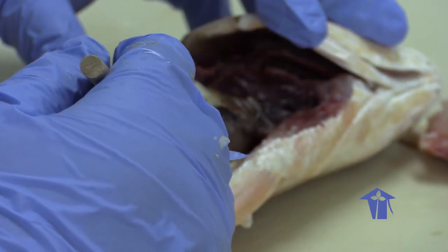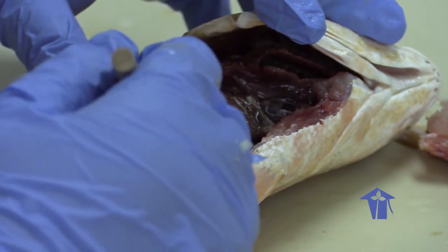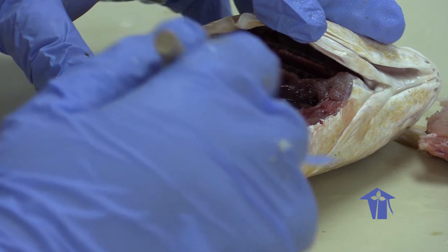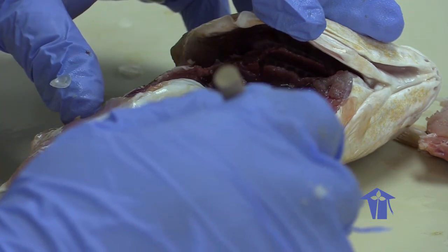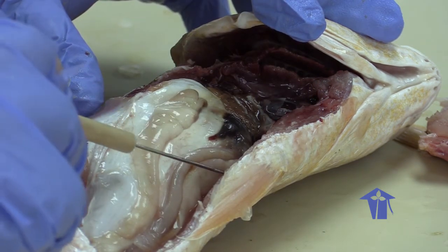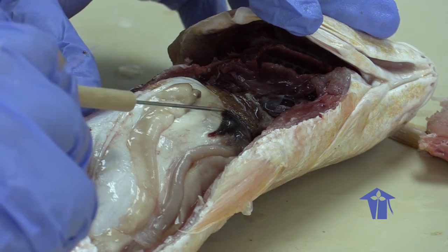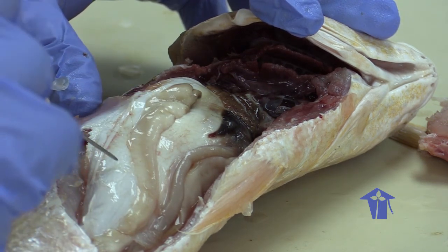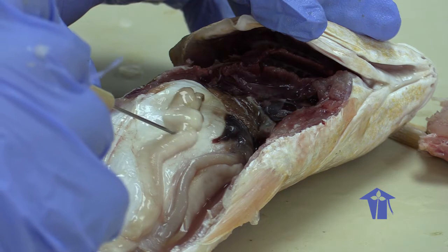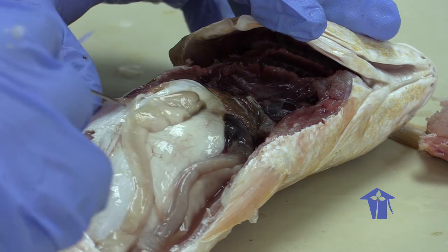Why I'm saying gonads as opposed to testes or ovaries, basically in a fish you can only distinguish between testes and ovaries by one of two things. If it is an undeveloped or an immature individual, you basically have to do microscope work to see if it's a testes or ovary. If it's a female that is ready to bear eggs, then this structure is going to be very yellow, very large, very yellow. It'll occupy most of the visceral cavity of the fish, and it'll have a very grainy appearance, right? So this here, I can only say this is either going to be an immature ovary or a testes, right?